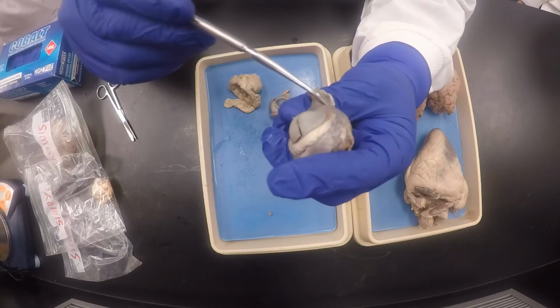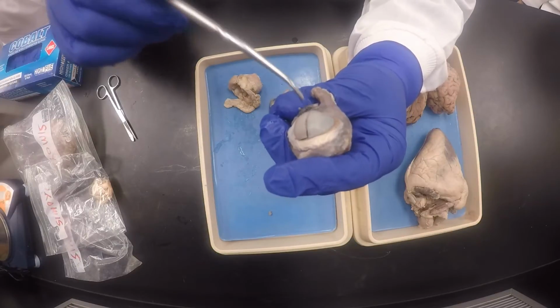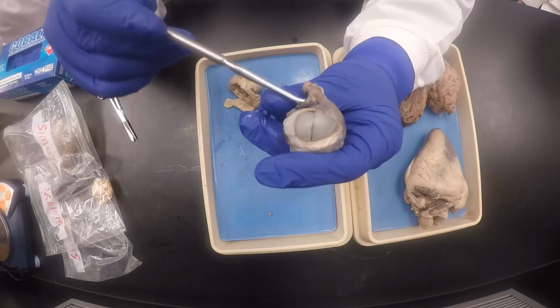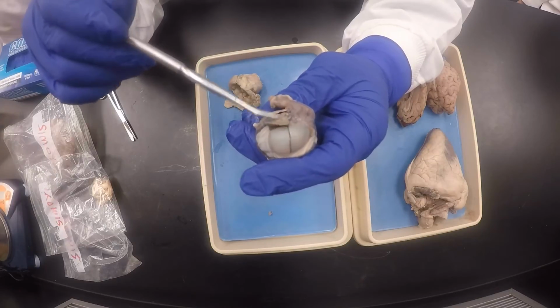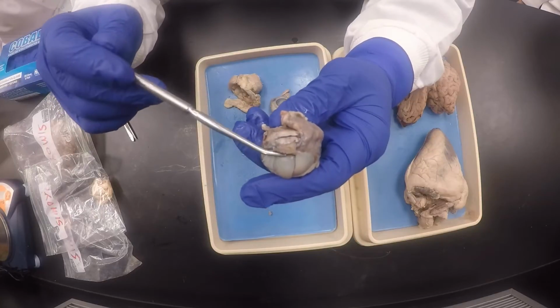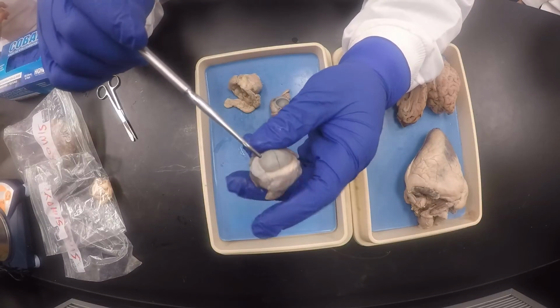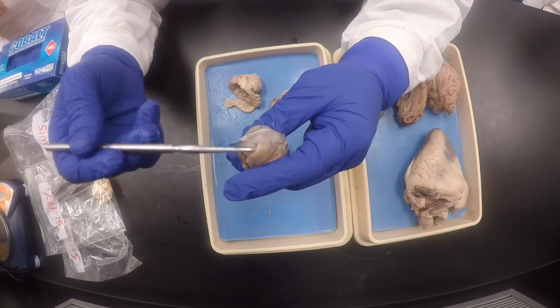And the one that's going down, that's the inferior oblique. And we said the inferior oblique points towards one of the long sides. And the long side it points to, since it's called inferior oblique, is the inferior side. So therefore, on there you'll find one muscle, which is the inferior rectus. Do you see that? By default, if this is the inferior side, there's only two long sides. The other long side has to be the superior. Make sense? Yes, it does.